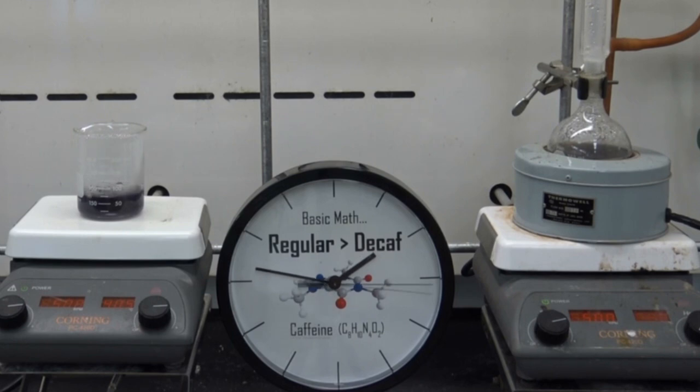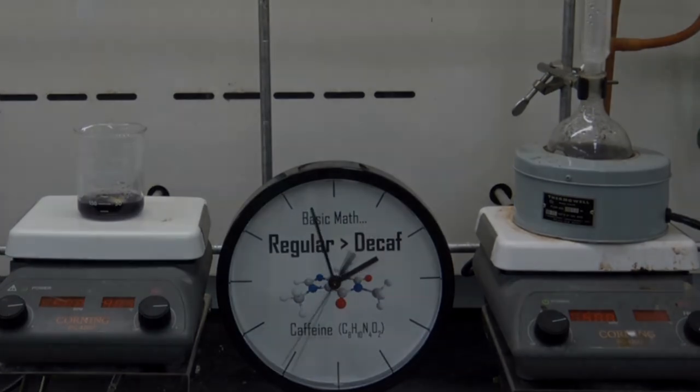Using this technique, I can heat my aqueous solution to boiling for a very long period of time. Here I'm running it right next to an open beaker, and notice that after 10 or 15 minutes, once again the beaker is beginning to lose significant volume. However, my reflux is not.